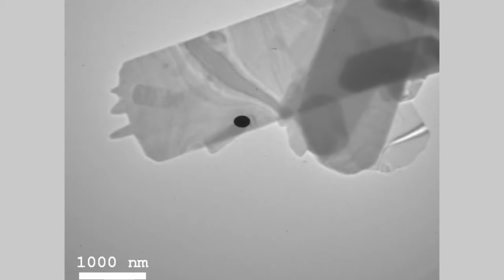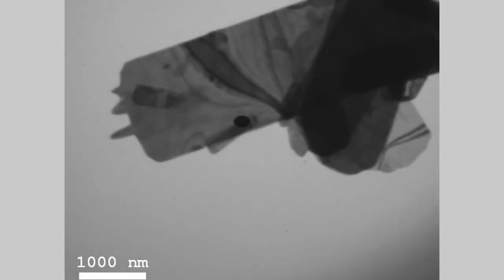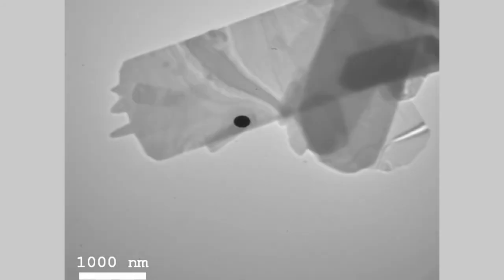I told you that the contrast in the image could be enhanced by putting in the objective aperture. We can try that. You see? The black things become more black. That means that the electrons that were deflected in the sample now have been filtered completely away, and they never hit the fluorescent screen. You can increase or reduce this effect by choosing different sizes of the aperture. And then we're back at the beginning.